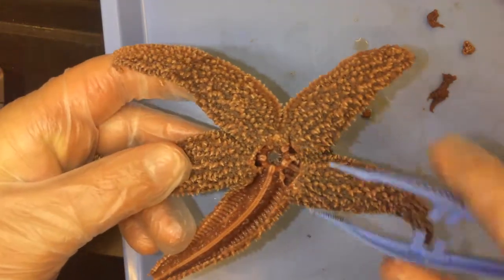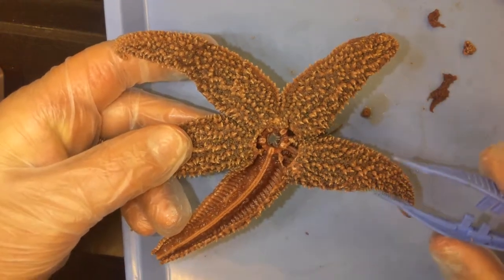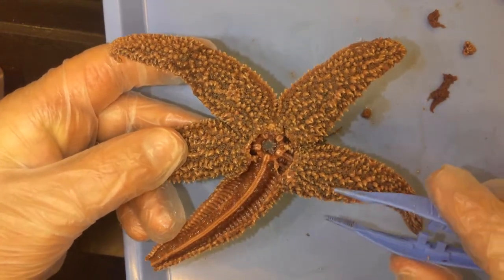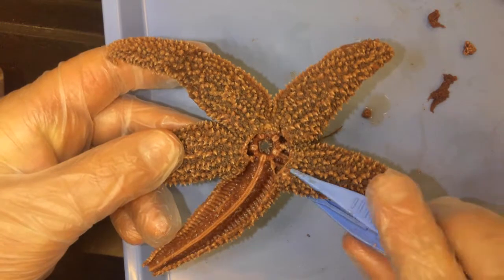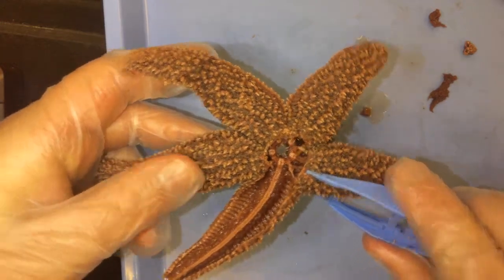I hope you guys enjoyed this dissection of the sea star, this fascinating echinoderm. Thank you.